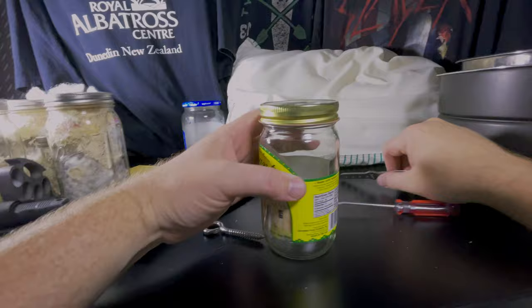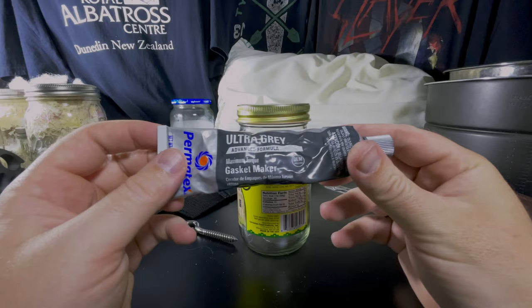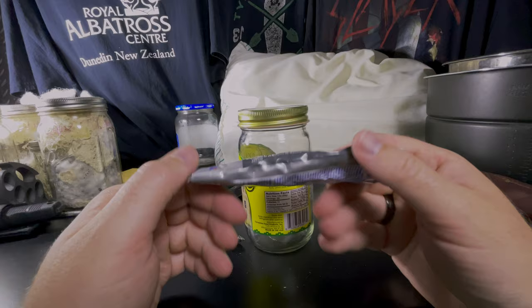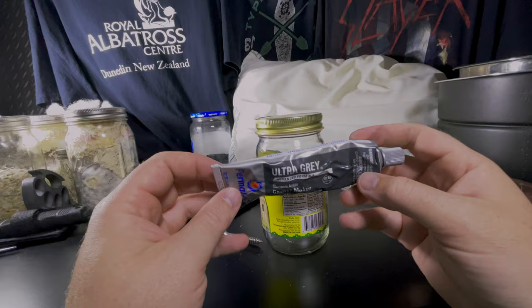And then I use this because I already had this on hand for car repairs and stuff. Why did I decide that this will be as adequate as other options? Well, if it's made for a car, it's going to be rated for easily the same as the pressure cooker is going to go to, or significantly higher. It's probably going to be at least 280 degrees or 300 degrees when it's something that's for a car.